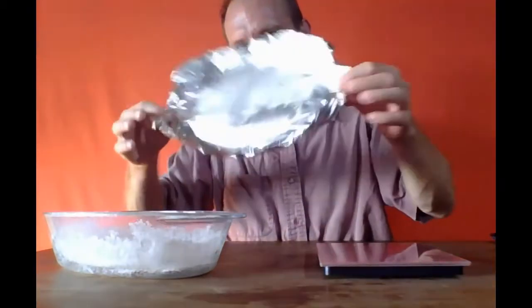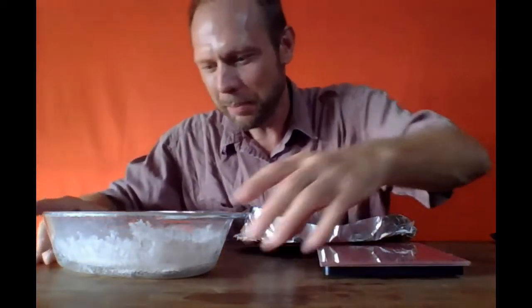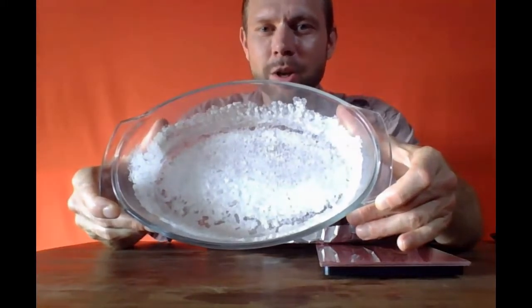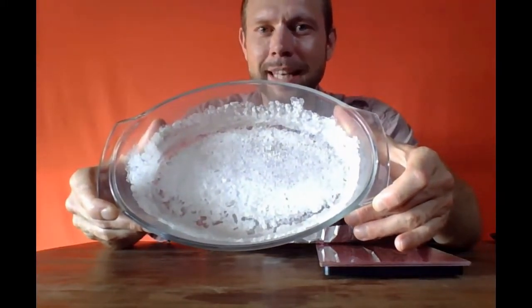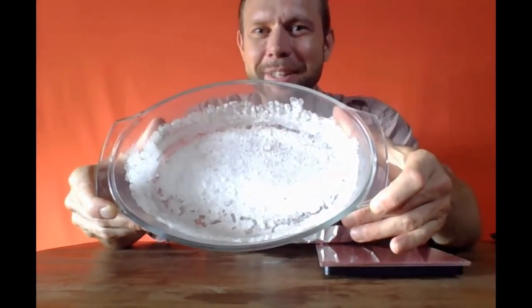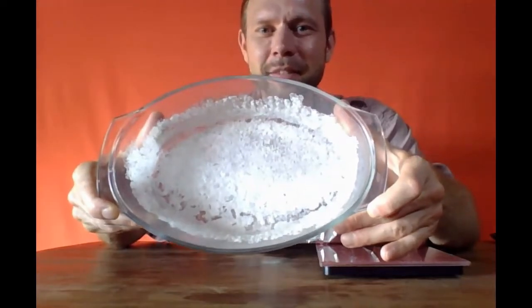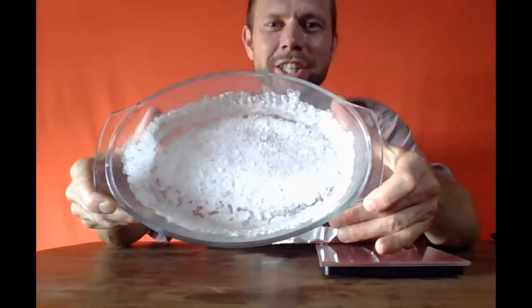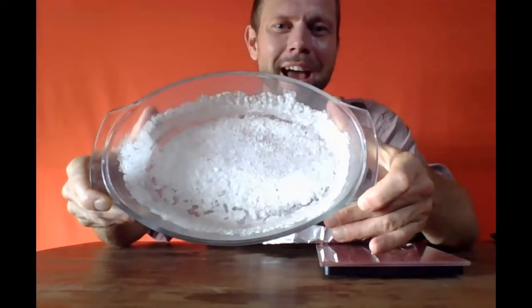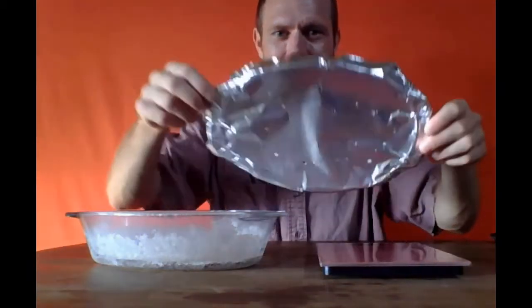I'm still not going to destroy this in case it turns out I wasn't quite done. I could maybe put it back and try to finish up. But here is the crystallized salt, and as you can see, it's spread in a thin layer on all the available surfaces. It crept up the walls of this glass dish, and you can imagine why you want to make sure that you have a lid, some aluminum foil, and yet, of course, the water does need to evaporate.